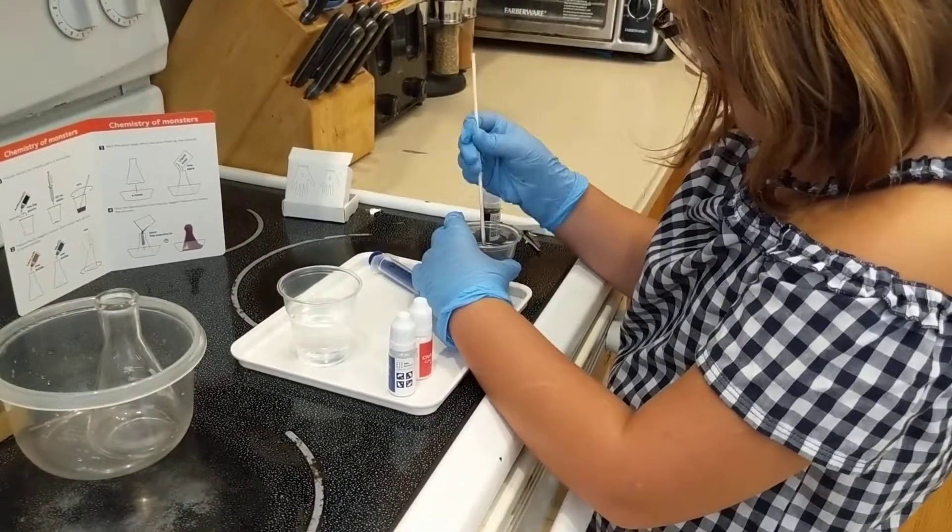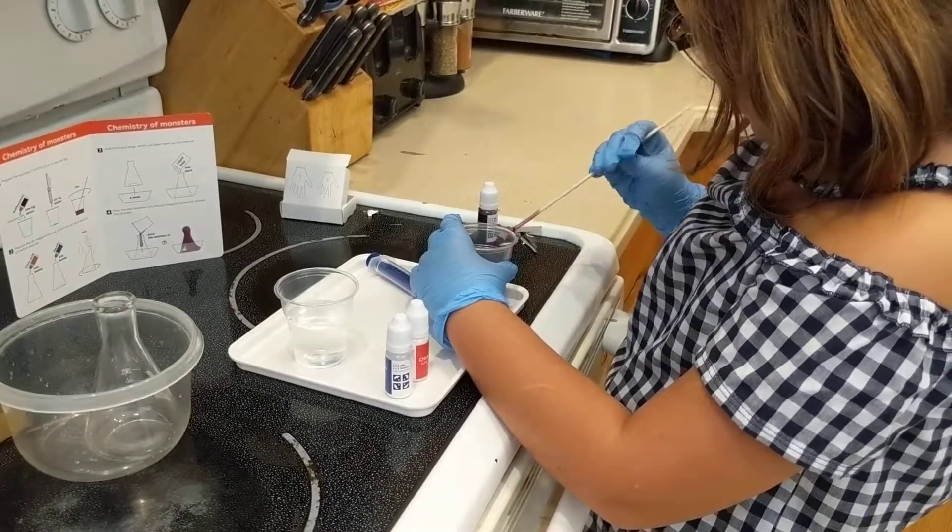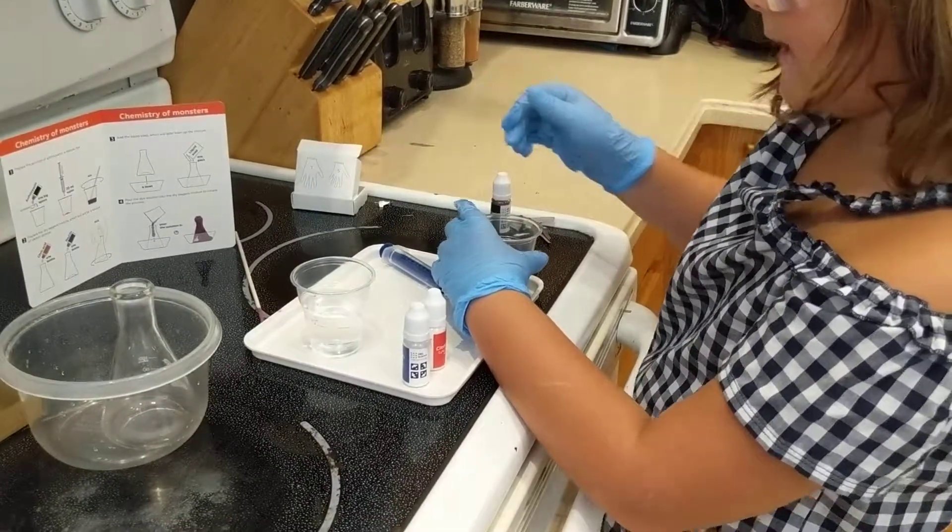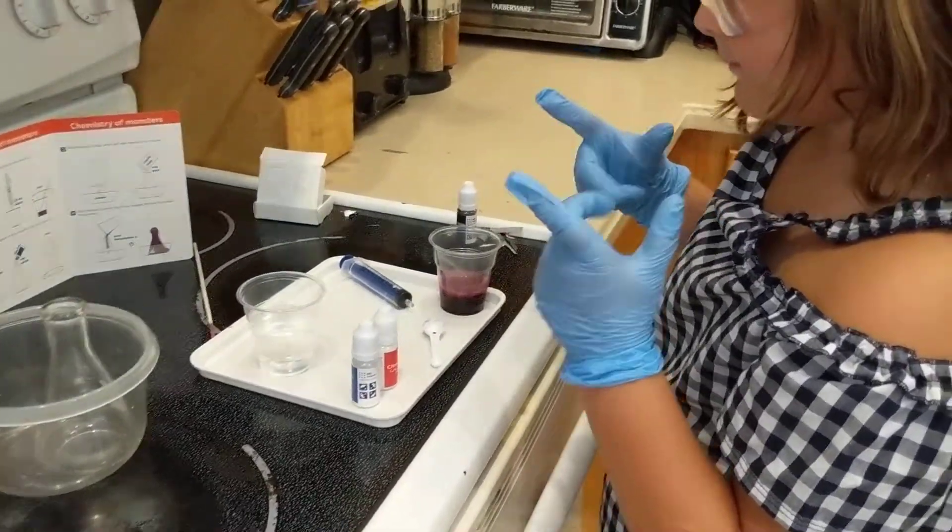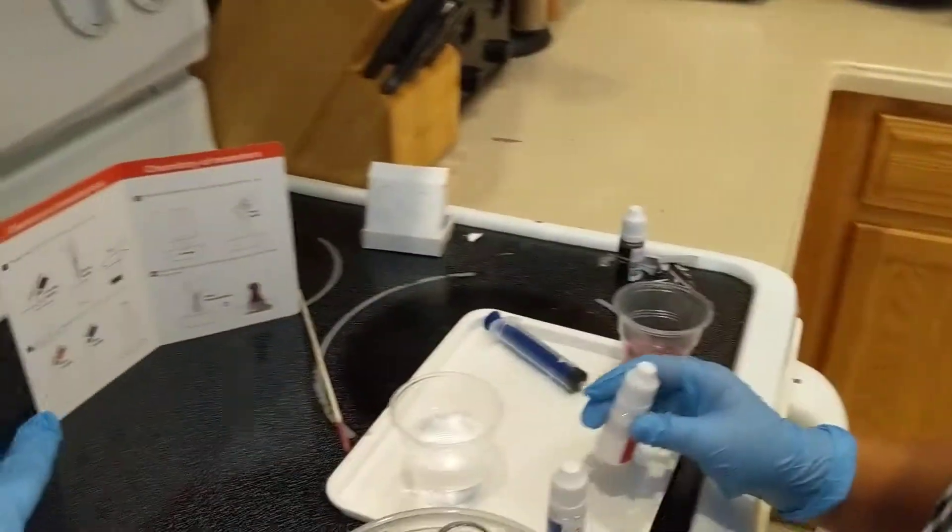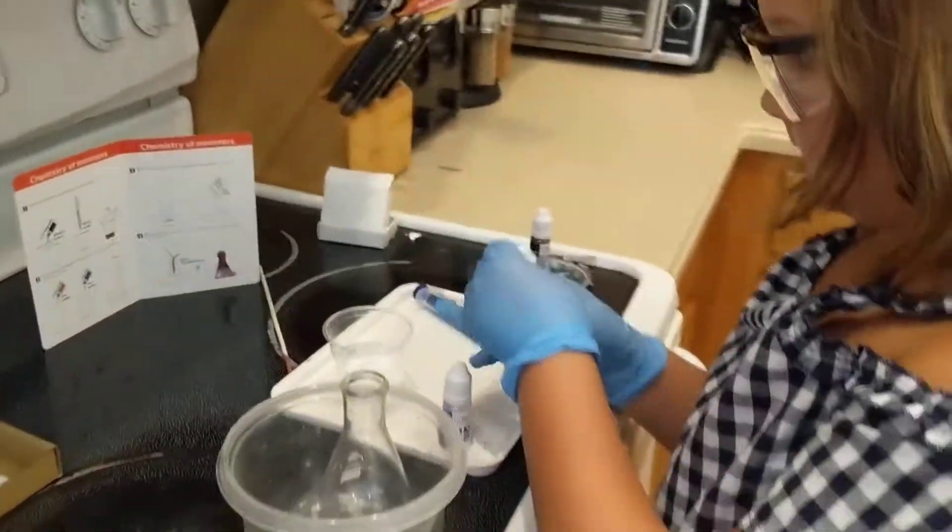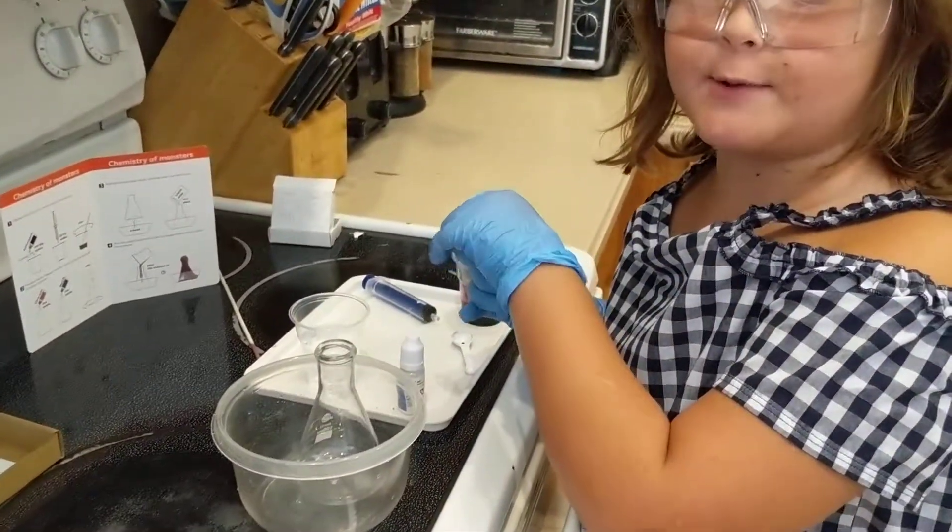Okay, that should be good. Okay good, daddy will be in here to watch, don't worry. Oh yeah, dad's here. And then what you're supposed to do, if you look on the thing, it shows you the whole red bottle and the whole blue bottle into here. So only once for this project.